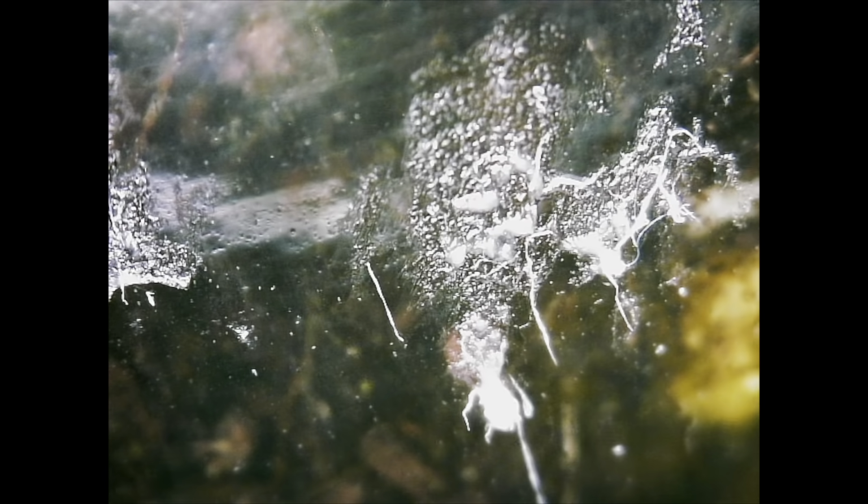This indicated to me that the composition of the water was definitely altered in the sense that whatever was present beforehand, likely high concentrations of arsenic and such, had become pretty diluted, and maybe there's a chance that there would be different organisms popping up here and there. So I decided to hook up my microscope and see if anything had changed.